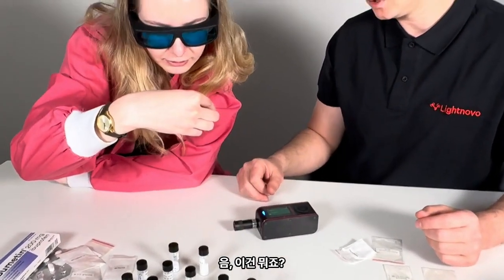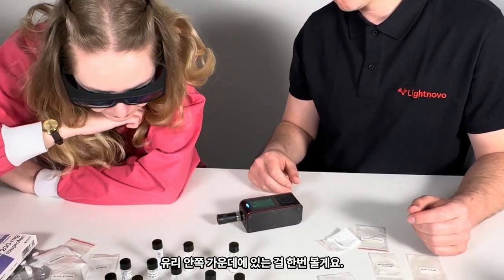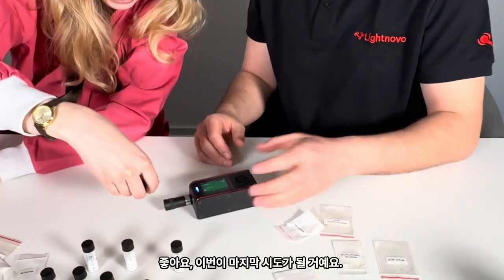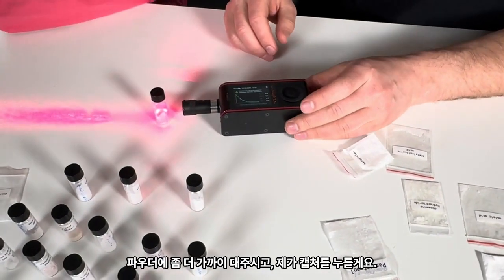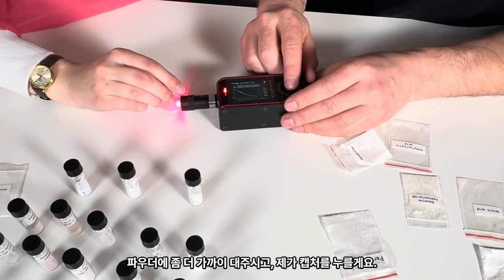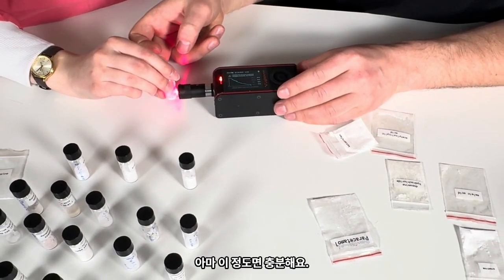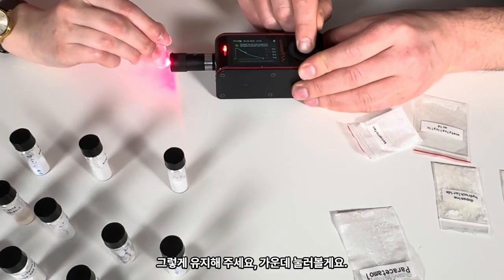Makes sense, I guess. A few more, and we end our demonstration. What is this? Aciclovir, I think. You see, it's indometacin in a glass again. Yes, indometacin. Let's do my favorite again. Okay, and that would be our last try. So could you get closer with the powder, and I will press capture. The penetration depth gets a little bit higher. Maybe it's enough. Keep it like that, and I press.